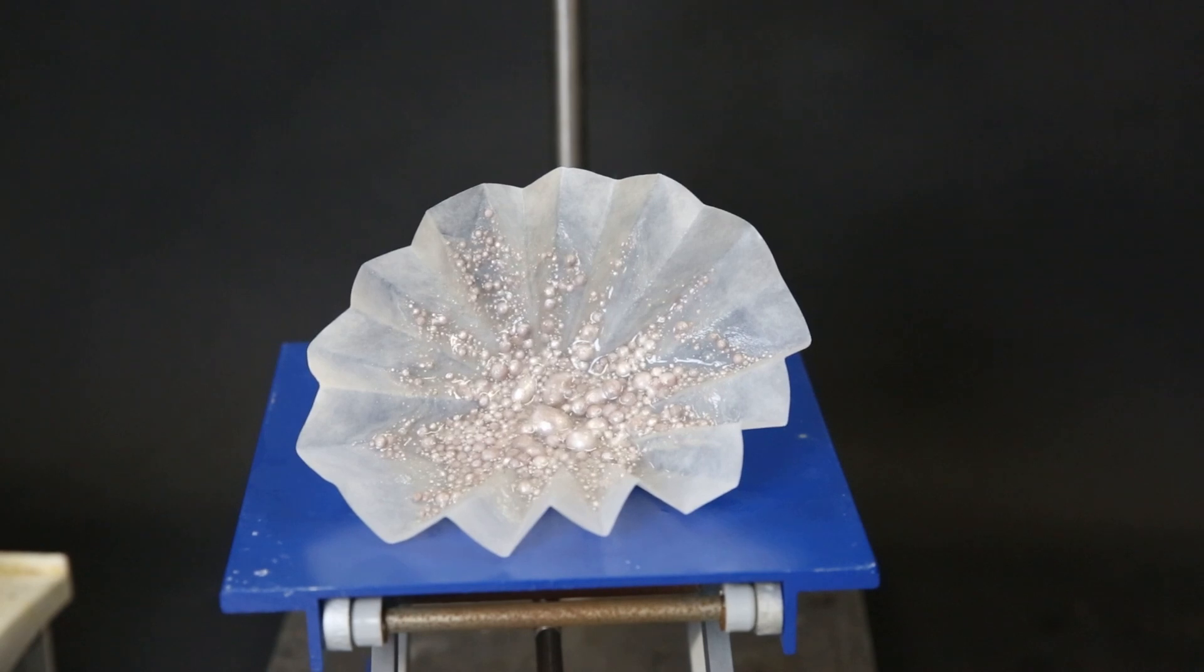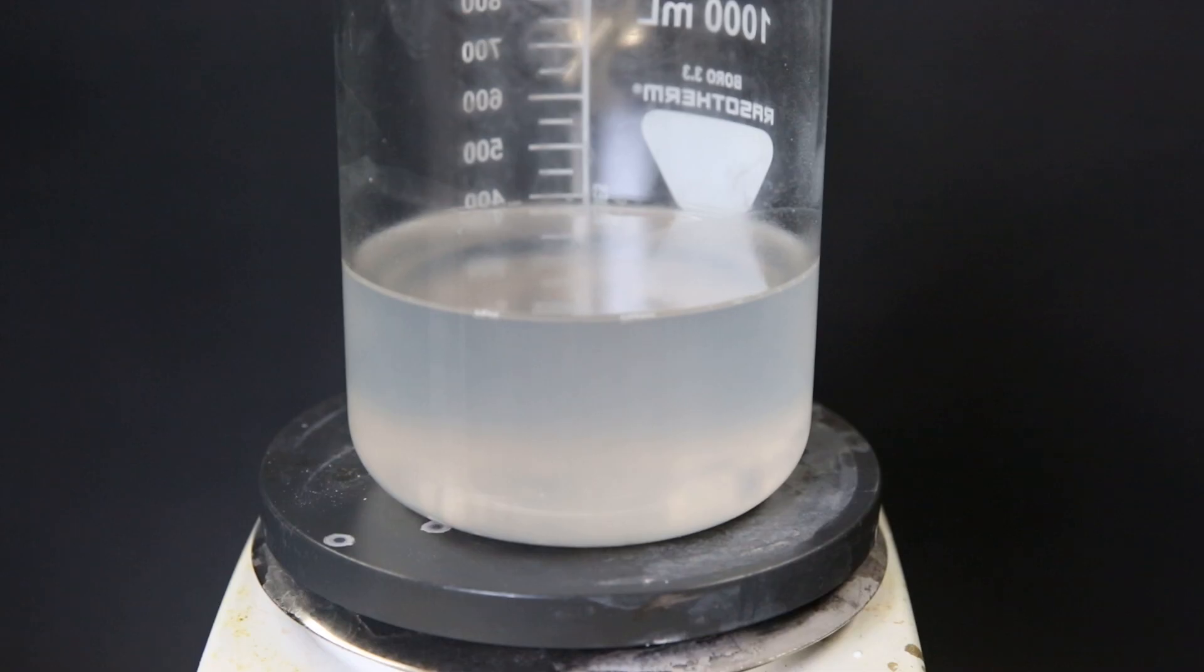So here are all the bits of sodium that I got but unfortunately it has a lot of little beads and I want one big piece. So to join them all together I put the filter in a bunch of toluene and got off all the sodium beads.